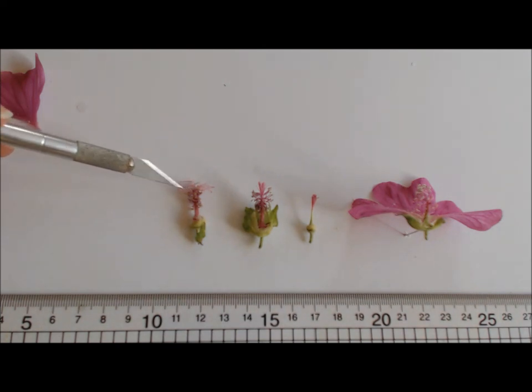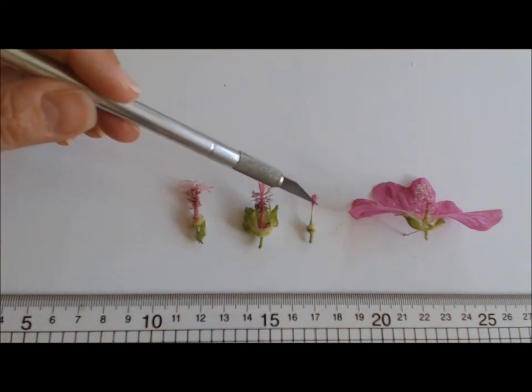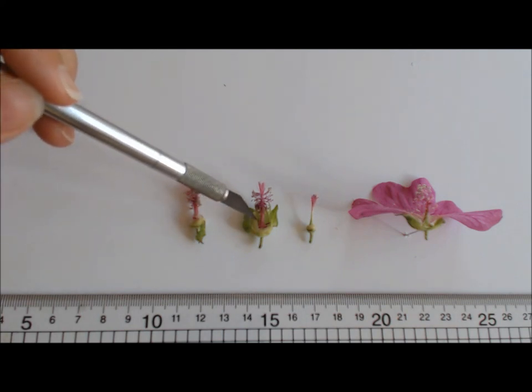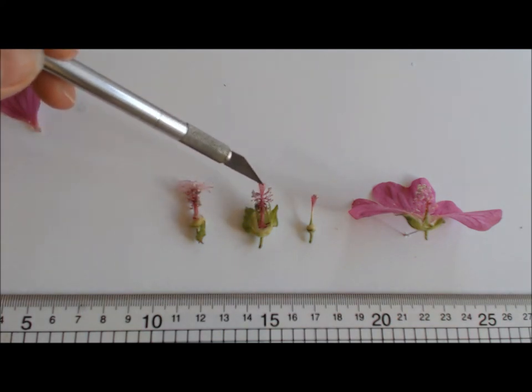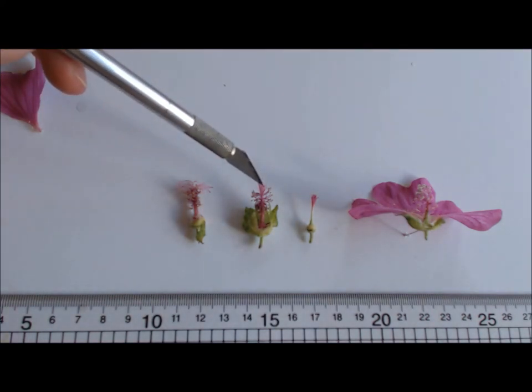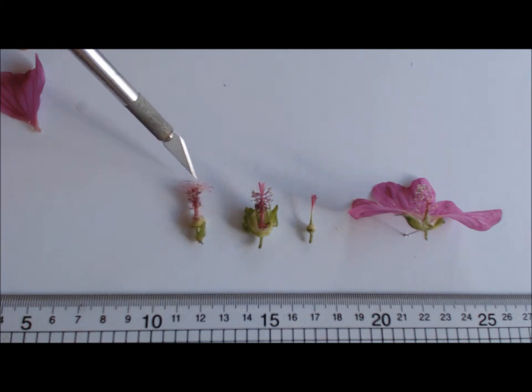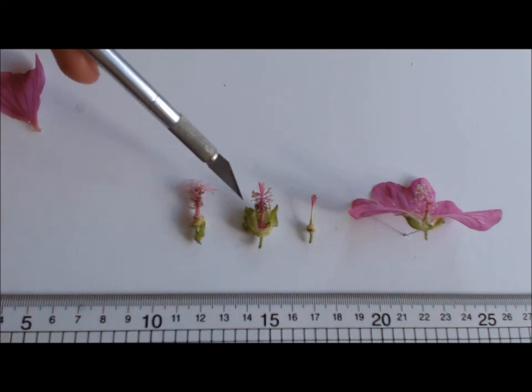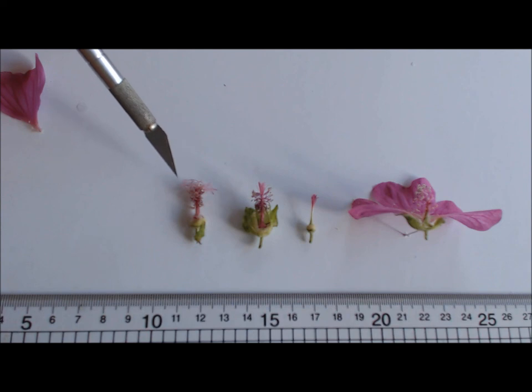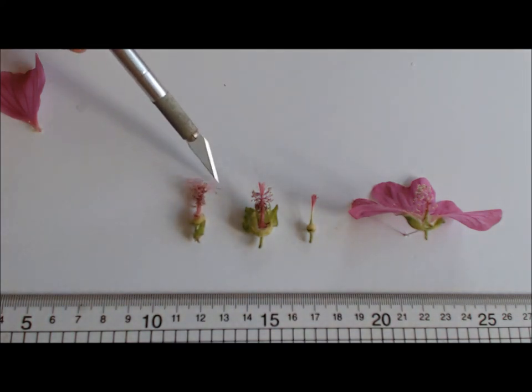Just to highlight the male-female phase within a flower, just one final thing here for you. You can see this one, as I told you earlier, where the female part is encased within this column. Here you can see where it's emerging from the column. And here in an older flower still, you can see it splayed out like that. The evolutionary purpose of this male and female phase is to prevent self-pollination within a plant. So it has various phases. There's more chance of cross-pollination when you have a system like this, where the male and female parts are receptive at different stages. That's basically what that phasing, male-female phasing, is about.